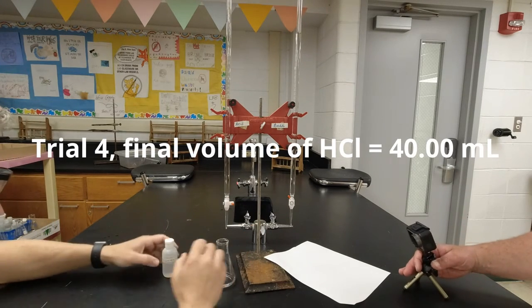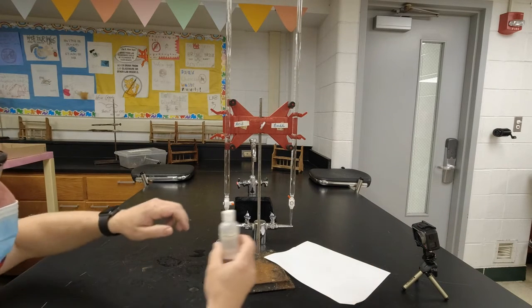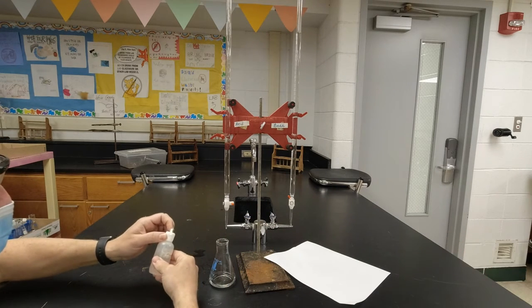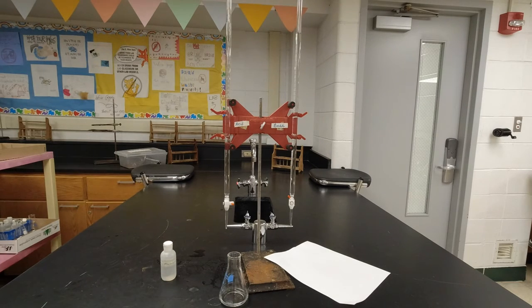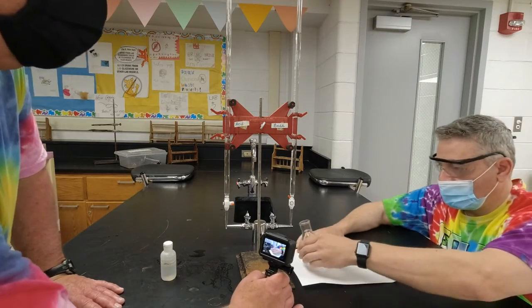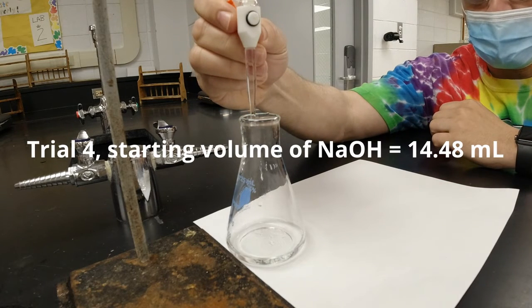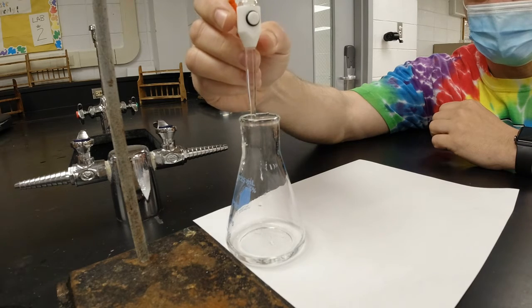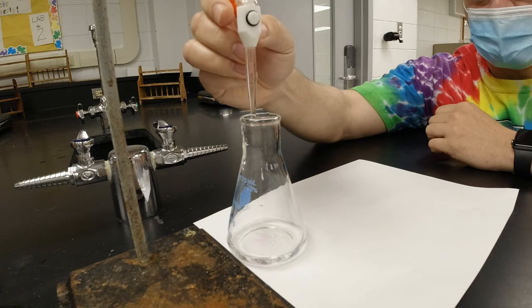All right. So now what he's going to do, he's going to add a couple drops of phenolphthalein. And I'm going to give him some space so we can come around on this side and titrate. We have a ballpark. How many do we think? It takes about 4.5 or so. A little more than 4.5. All right. So again, just like you saw before, it turns slightly pink and then it disappears as we get the neutralization going.